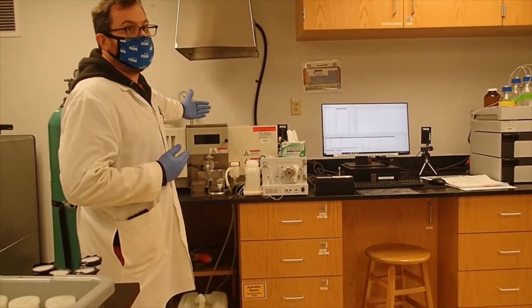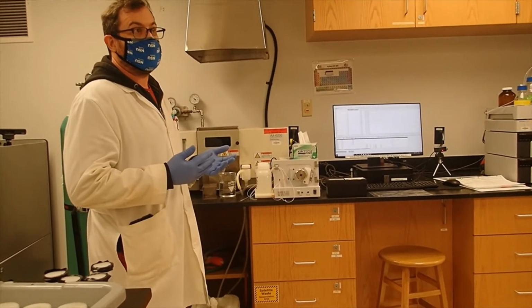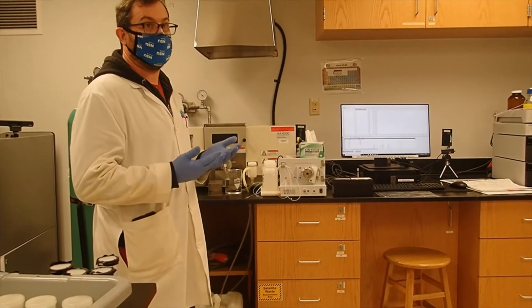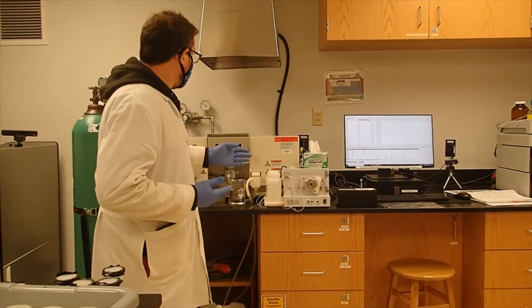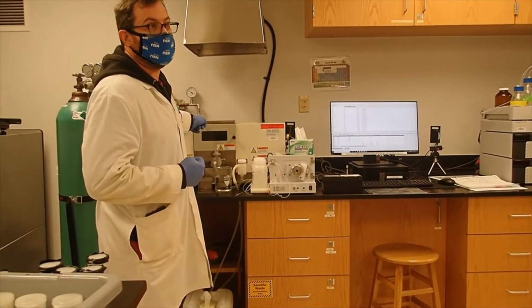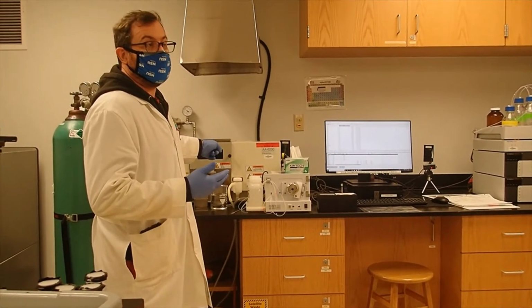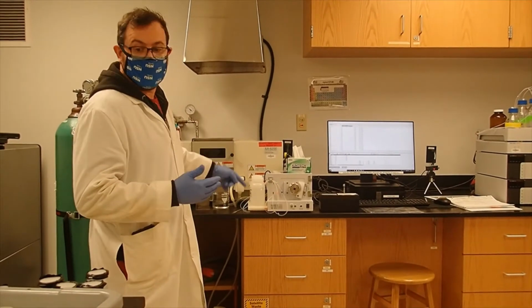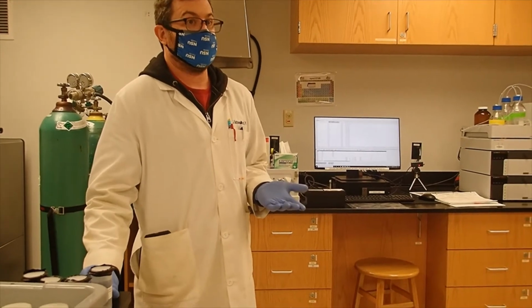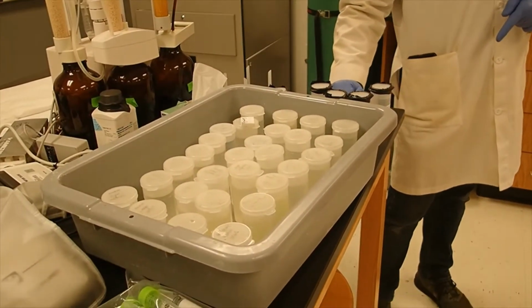So we're going to have a flame burning here, and it will spray our sample into the flame. And when lead burns, it absorbs light from specific wavelengths. So without lead, 100% of the wavelength light will make it across. It's 217 nanometers. But when there's lead there, some of that will be absorbed. So it will measure how much is absorbed. So what we do is we have these known standards. We'll create a calibration curve with those, and then we compare all of our unknown samples to the calibration curve.